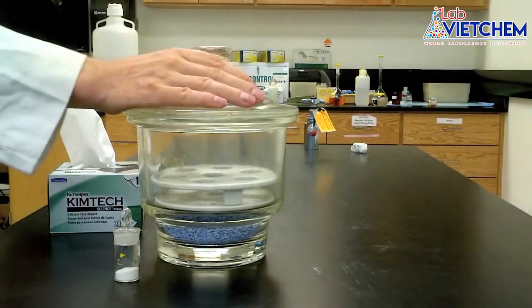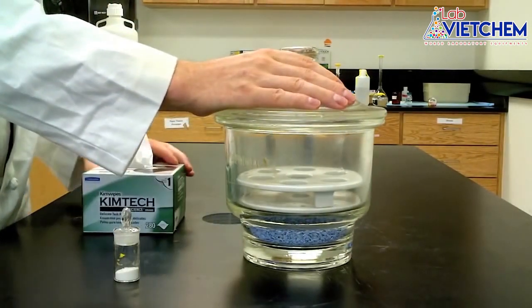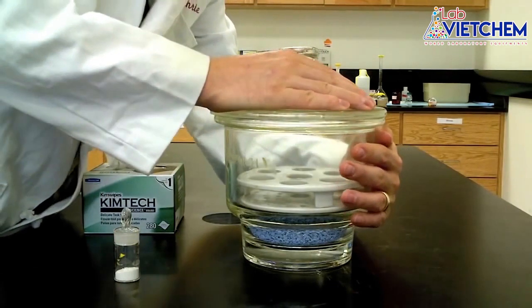Okay, so opening the desiccator isn't so easy. You can't just lift off the lid, that's not going to work.